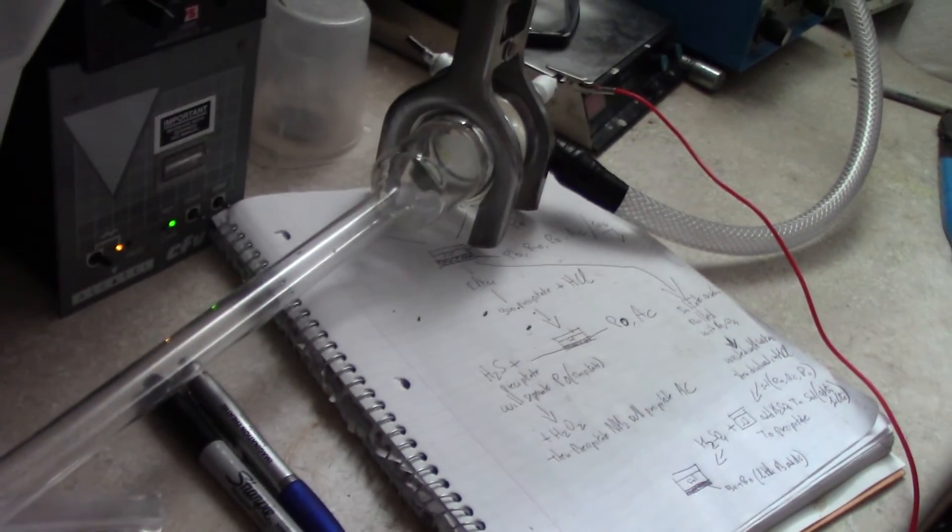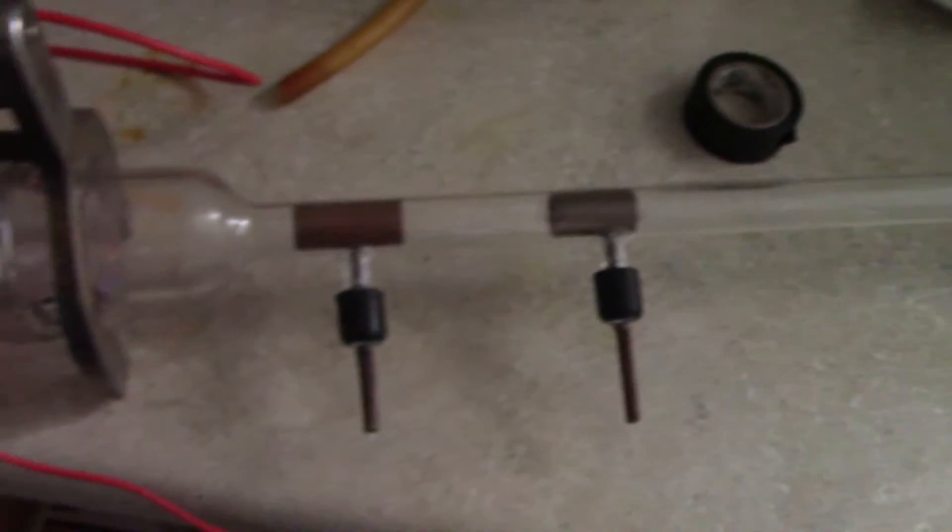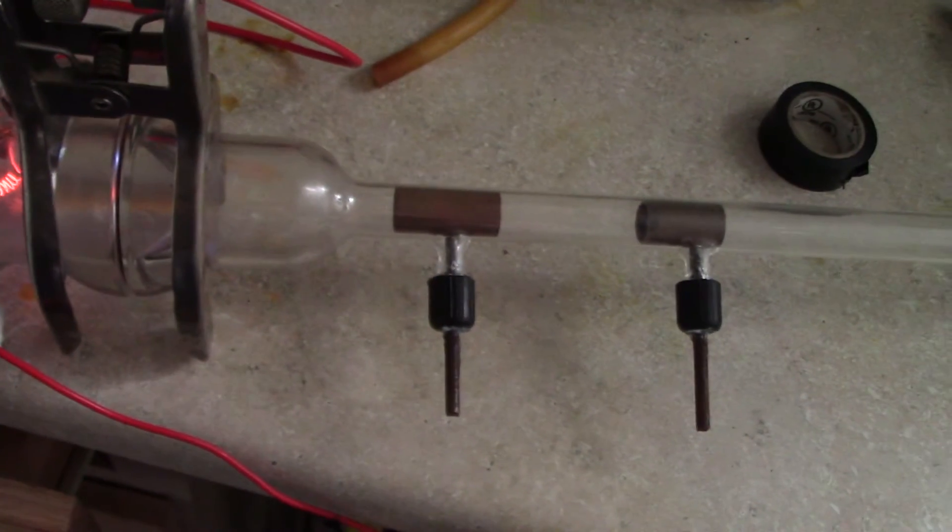Right now I think the vacuum is not high enough to get any electron passing through. The mean free path is too short. Probably stopped somewhere here.